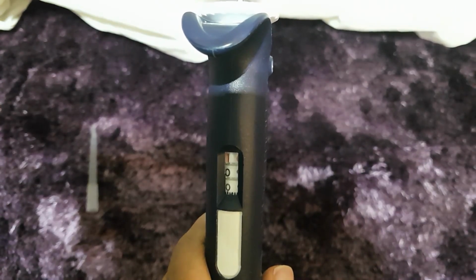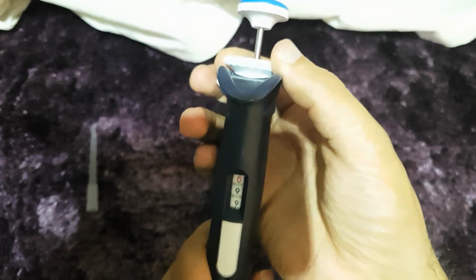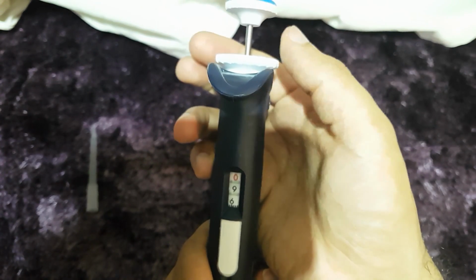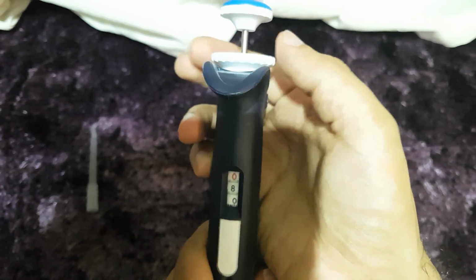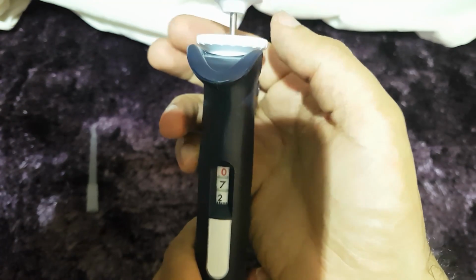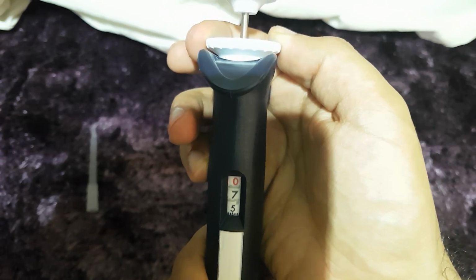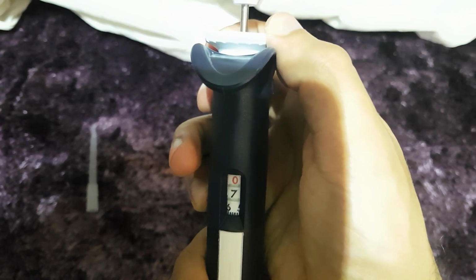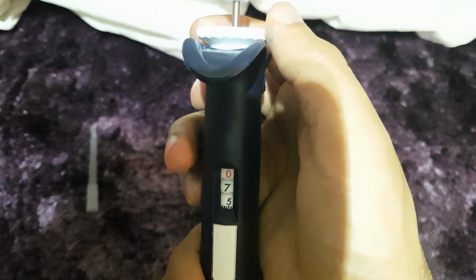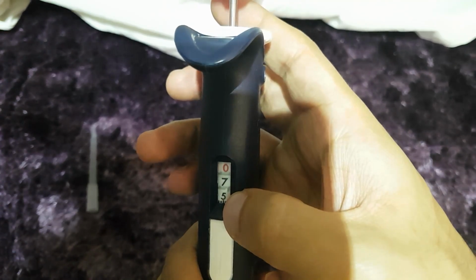Now we're going to adjust this pipette to a volume of 750 microliters. Simply turn this volume adjustment knob until we get to 750 microliters. So, just keep turning. And whoops, we've gone a bit too far, and here we are. As you can see, there are some little lines here, and each of those lines, if we count, is an interval of 2 microliters. So directly on there is 750 microliters.